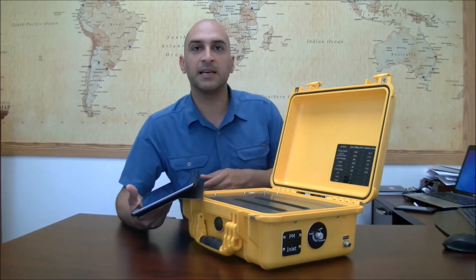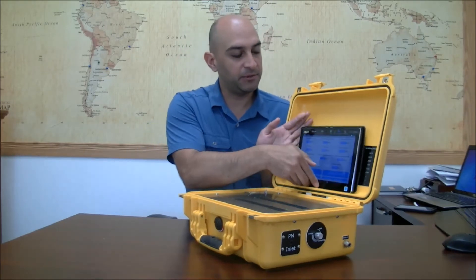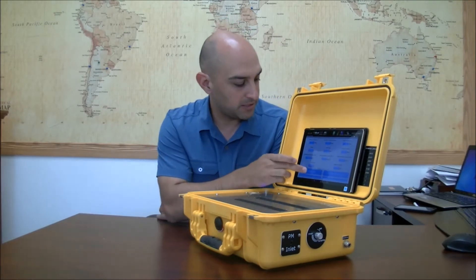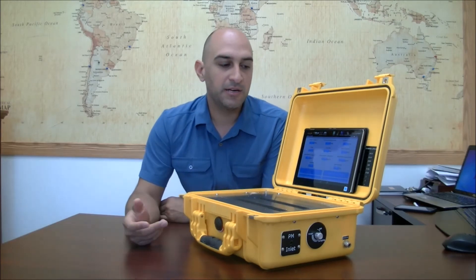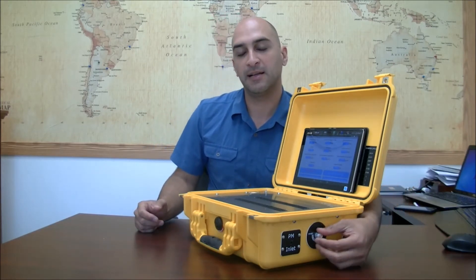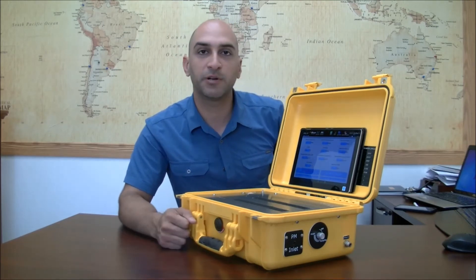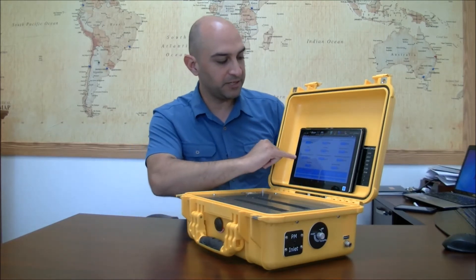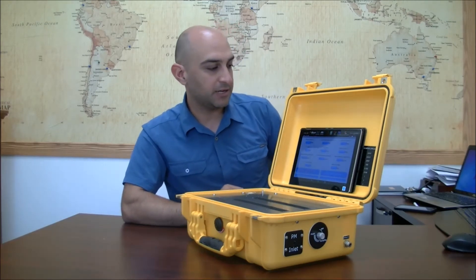This is quite useful as an indoor air quality analyzer. So I have the tablet — I'll put it here so you can see. Now we're going to start sampling. Here you see the pump is running, and the pump is feeding all those sensors. It can speed it up or slow it down depending on if you're sampling from a source that has negative pressure — you might want to speed it up. But the point of our video here is these three particulate readings, and we're going to test it out.